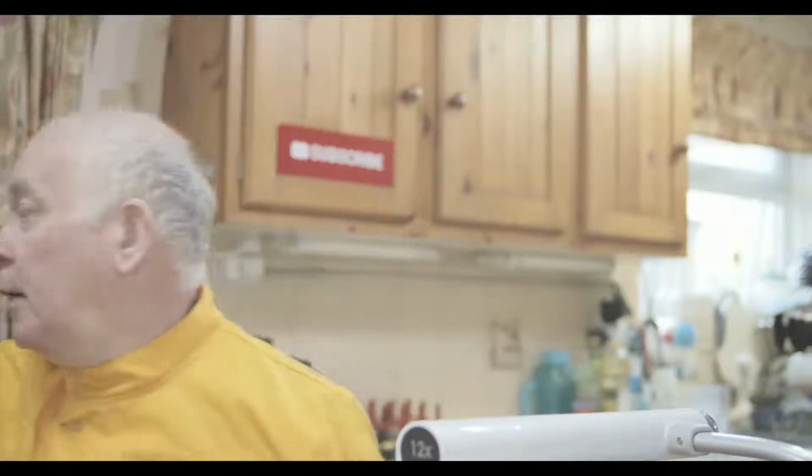Well, good morning. We're going to have a look at some biology today. We're going to have a look at food tests, some tests for proteins, and some tests for carbohydrates and lipids. So let's have a look at some of those.